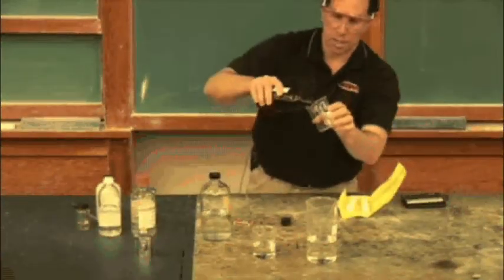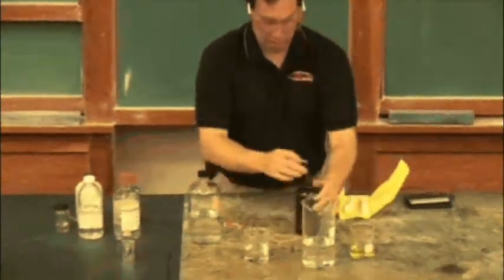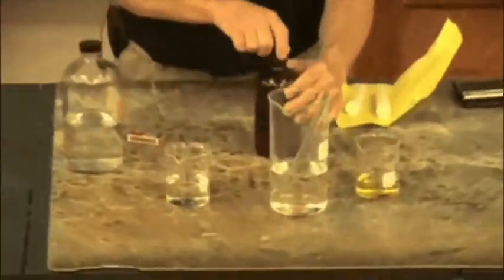I have some potassium iodide, some KI, so I'll put some of these in. This is a very concentrated solution of each. We have one molar, one molar of each.